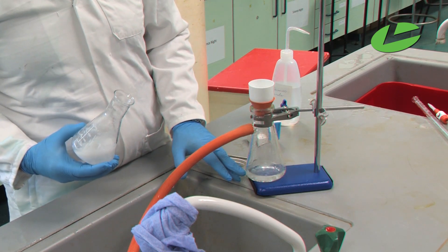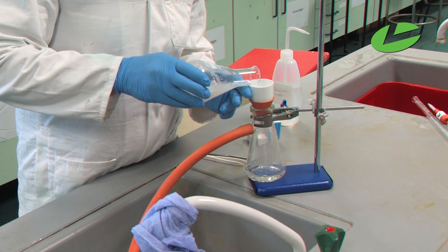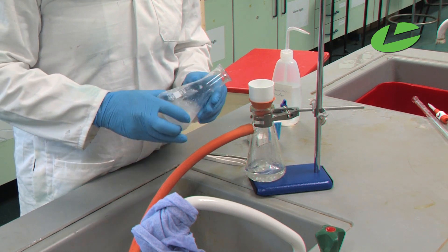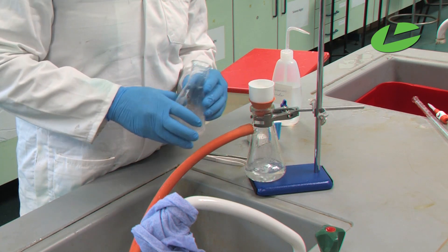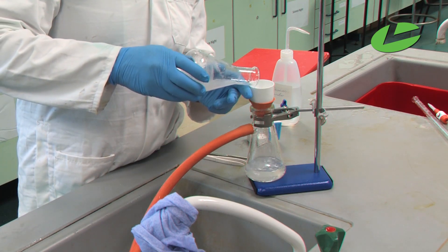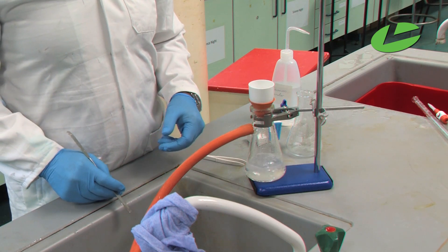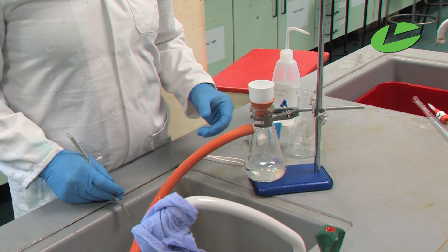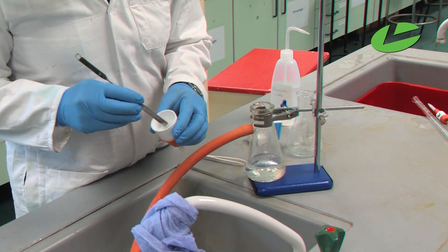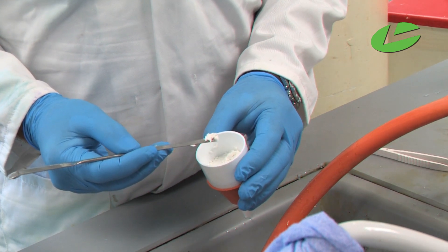You can see the clear liquid going through into the bottom of the container. Swirl the flask periodically to get any crystals off the side of the conical flask. And now we can see clearly, when I remove the filter, the crystals of benzoic acid product on top of the filter paper, which we can dry and weigh to calculate the percentage yield from the reaction.